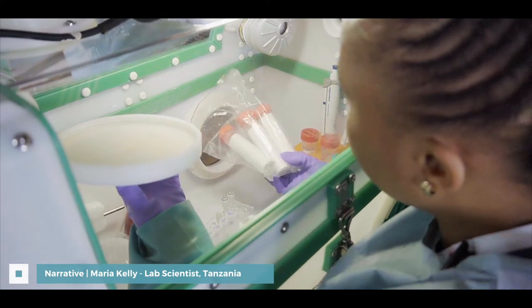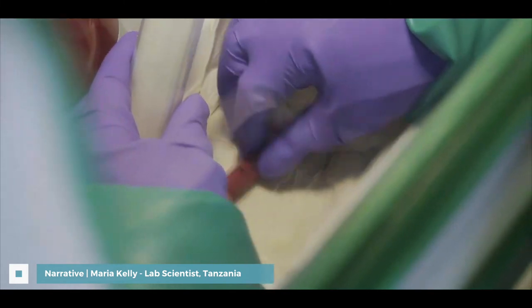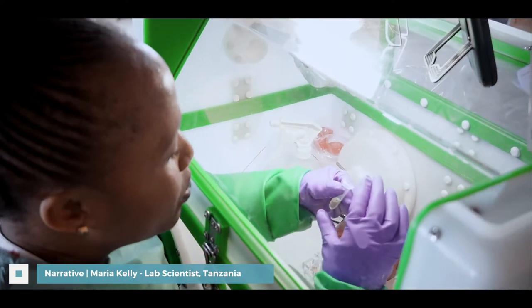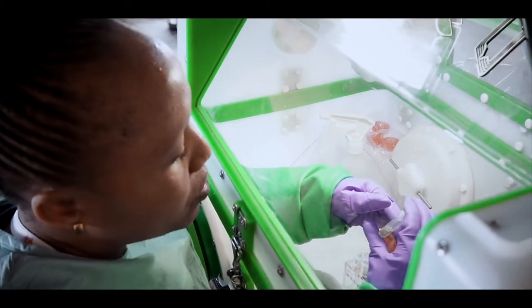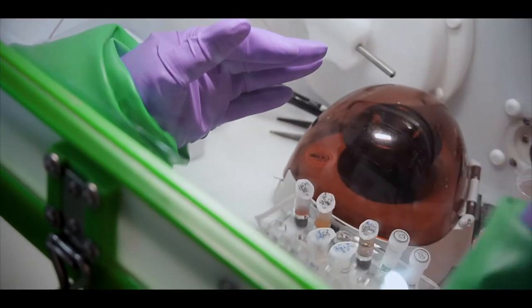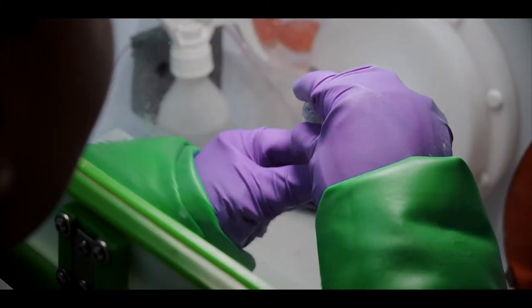When you open the sample, you need to clean it using bleach. After you have already added AVL to your sample, you need to incubate the sample with AVL for ten minutes. After ten minutes, we can continue with the inactivation process.